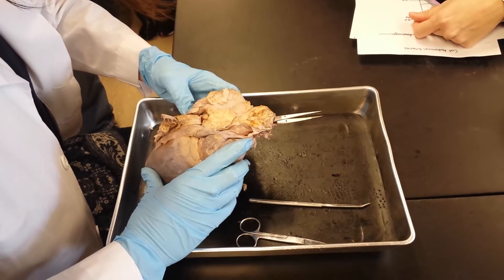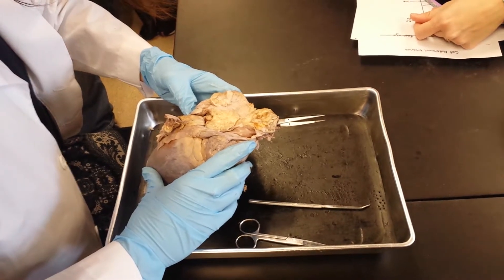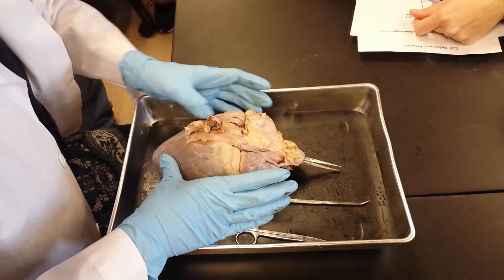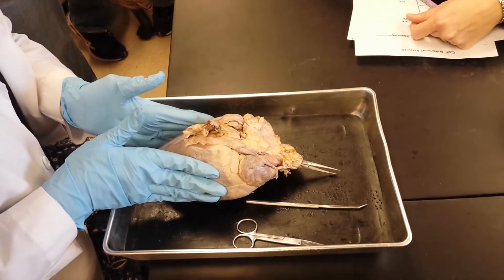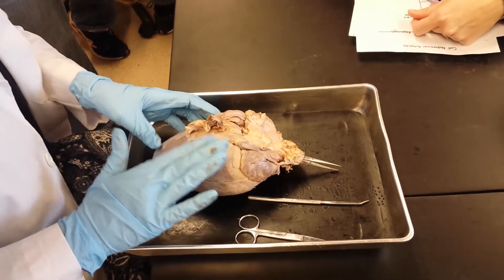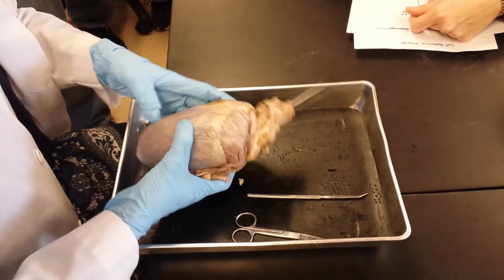I think that's everything on the exterior. Again, we have our atria; our ventricles would be down here. We talked about the epicardium, sulcus, and blood vessels.